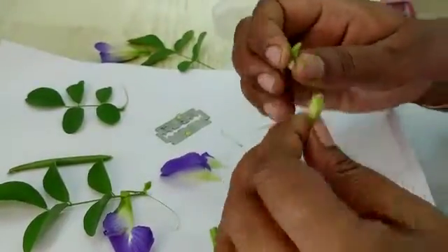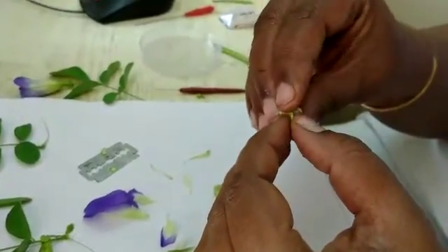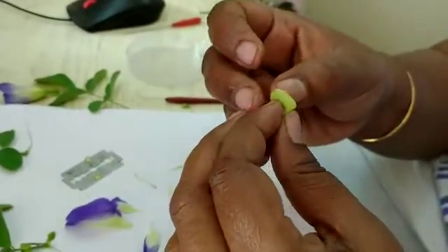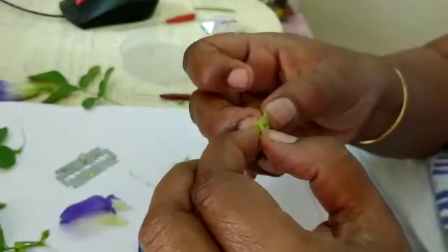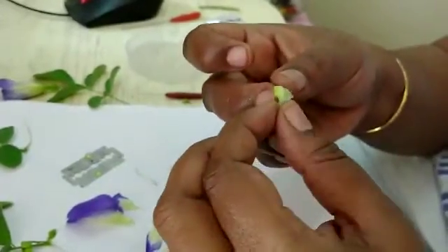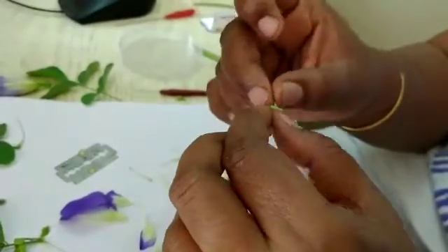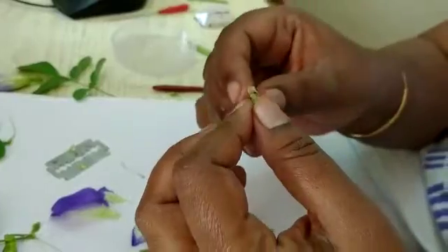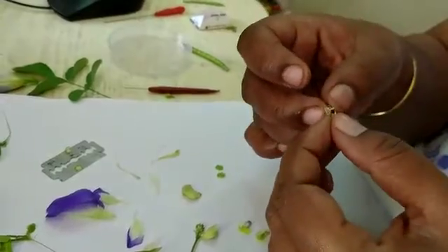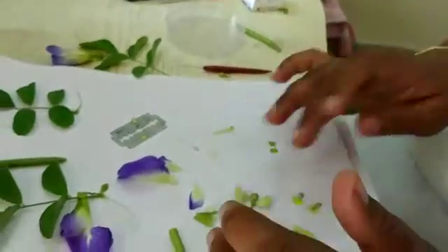This is the flower of green gram. In this also, calyx is present and the petals — standard petal, wing petal, and keel petal — are all present. You can see the stigma here. The stigma shows a 90-degree twist — you can clearly see the twisted condition.